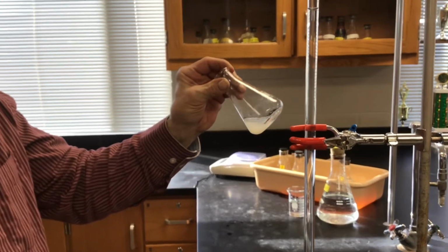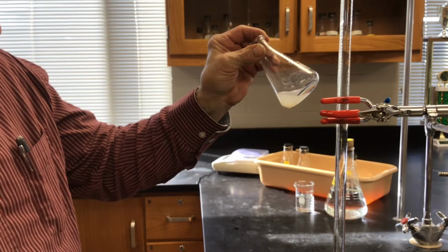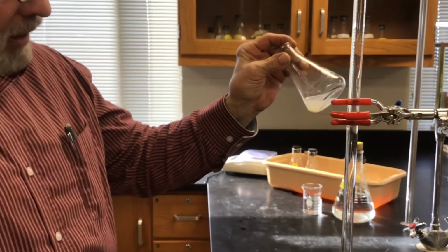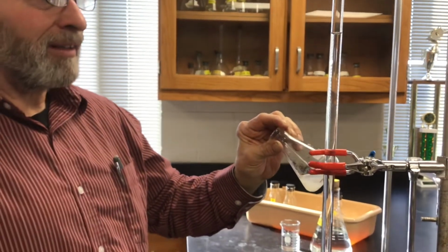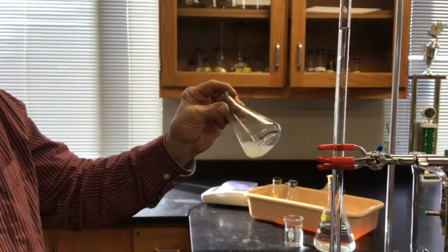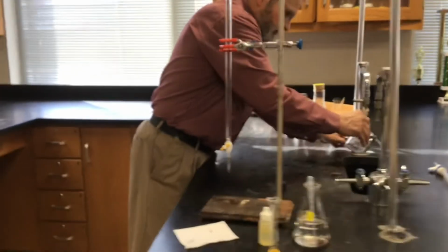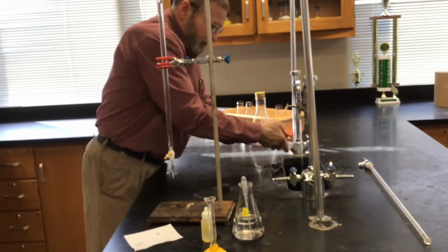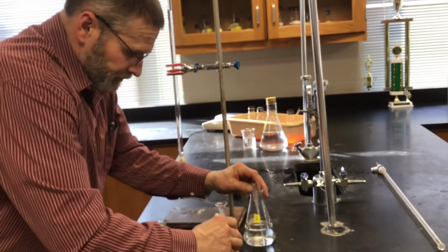That's quite a bit less than I used the first time. It's not white anymore. You might almost have to run a third one, do you think? Yeah, I think that's at the end point, or close to it. Okay, let's try one more. It doesn't take too long to do.